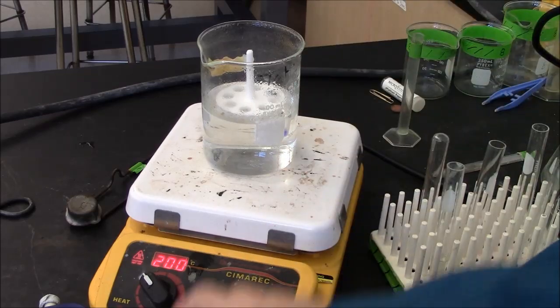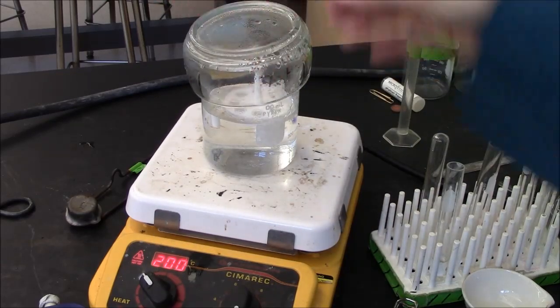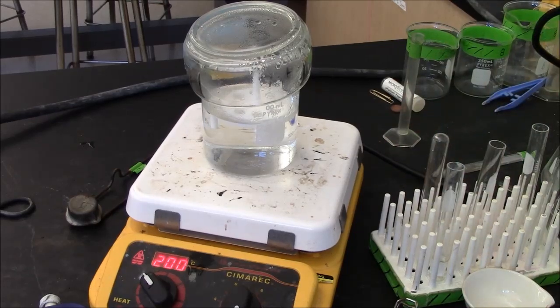This will be for about 5 minutes, so I set a timer. The water doesn't have to be boiling but it should be very close to boiling, above 90 degrees Celsius.